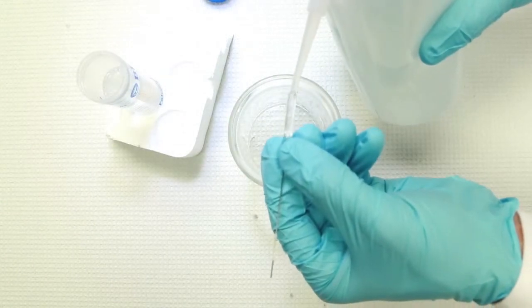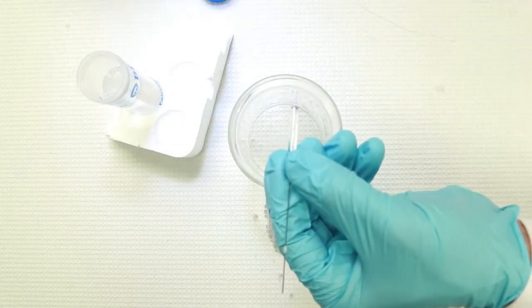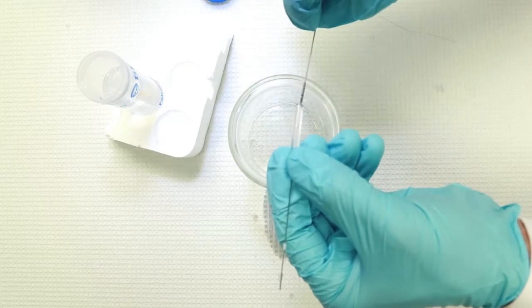Finally, rinse your syringe out as well as possible with water before reinstalling the syringe in your instrument.